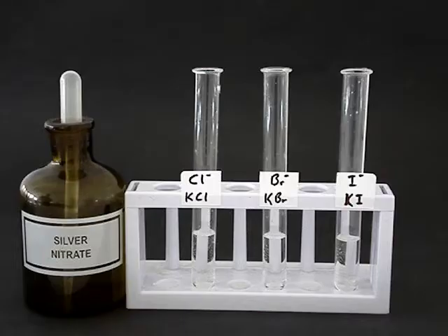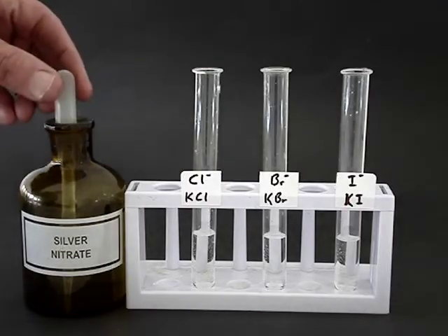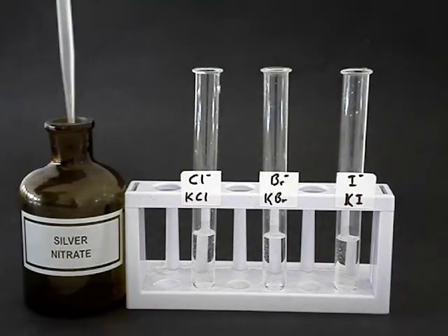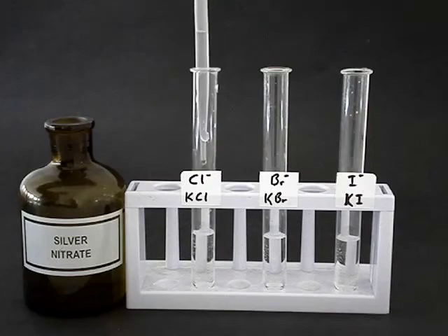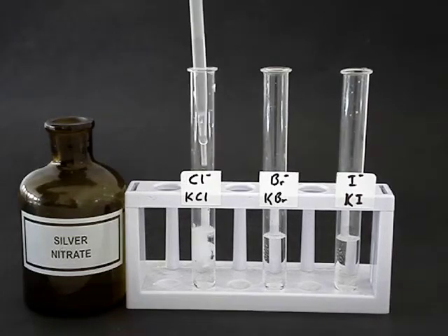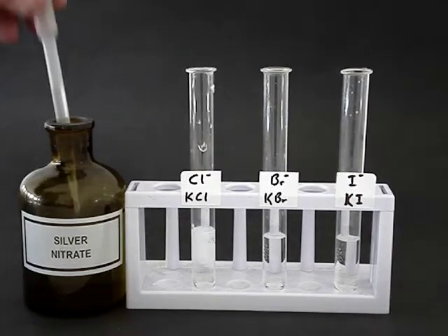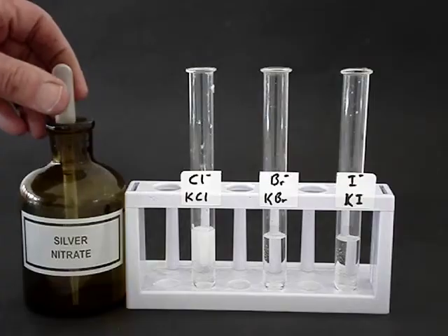We add a bit of silver nitrate to the first one, and notice that as soon as we do so, we get a white precipitate — and that is silver chloride.